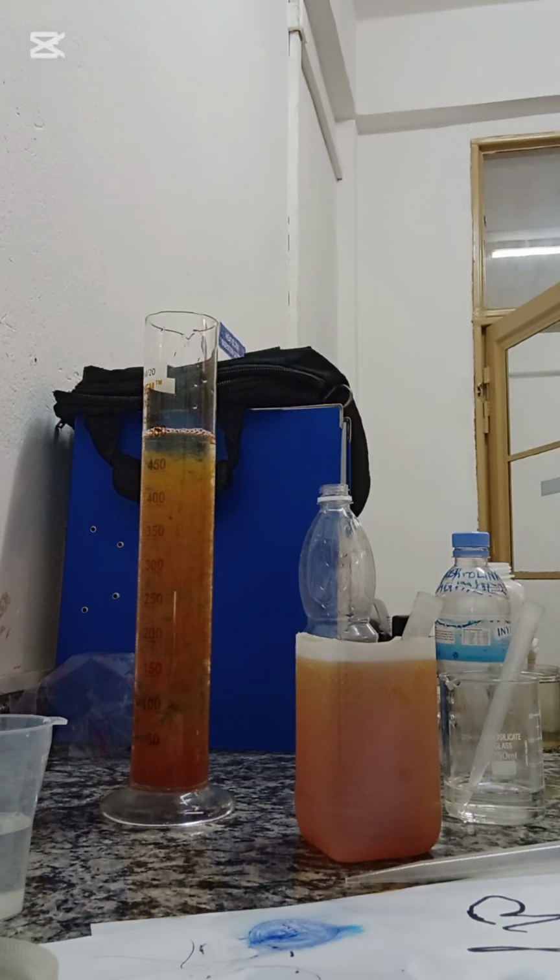The separation. Now the hydroxide ions and the negatively charged ions present in this water in the form of colloids have started bonding together with the iron 3, and this is what is happening. So the colloids together with the iron 3 are the ones that are coagulating, and as you can see, they are settling down. So it is easy to achieve filtration. It is very easy to achieve filtration if you flocculate.